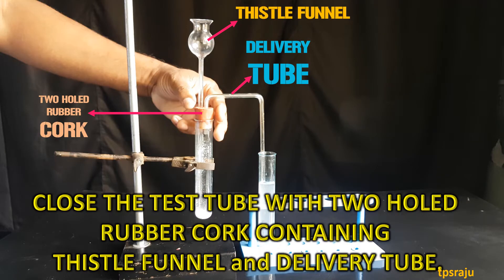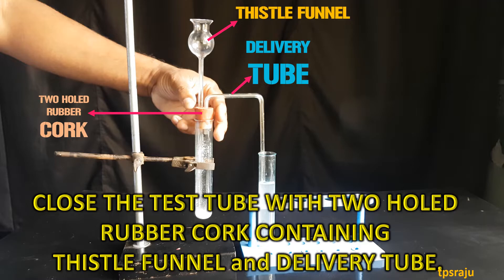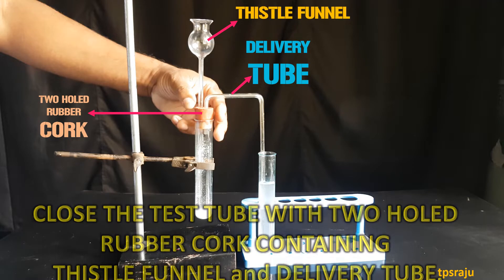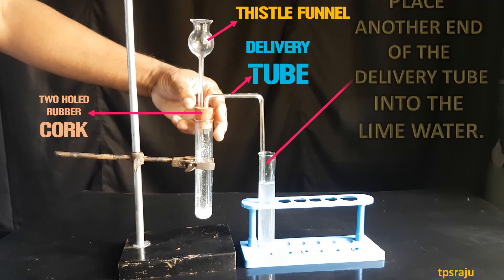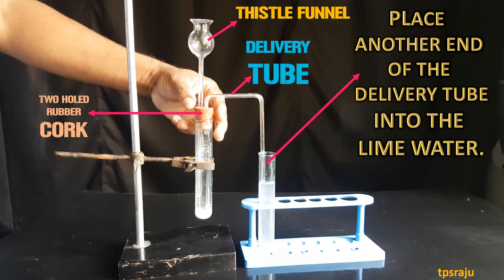Then close the test tube with a two-hole rubber cork containing the thistle funnel and delivery tube. Place the other end of the delivery tube into the lime water.